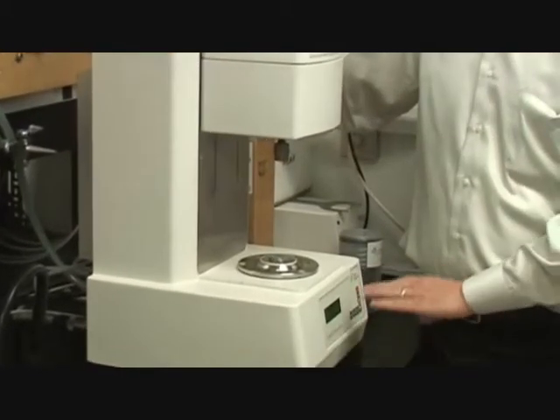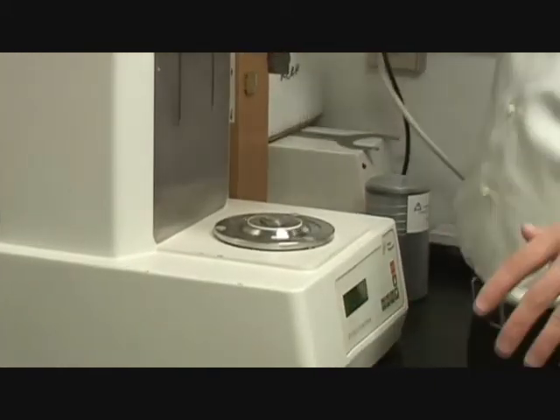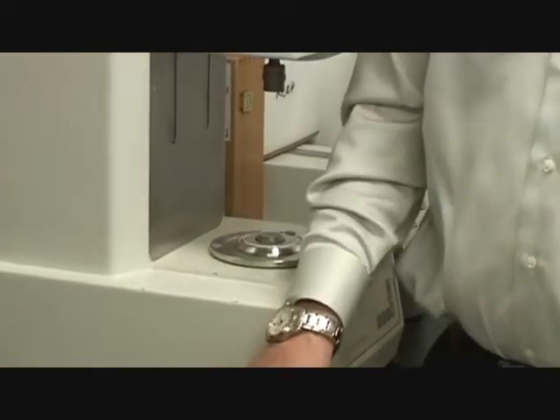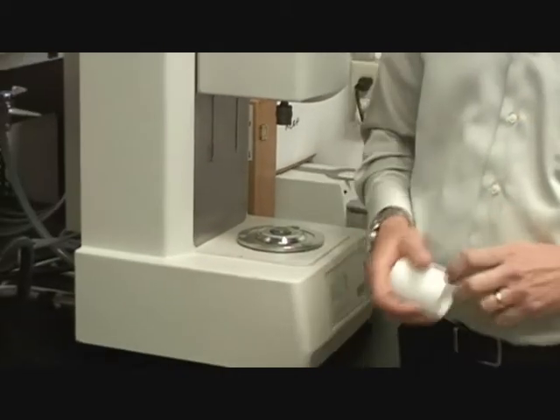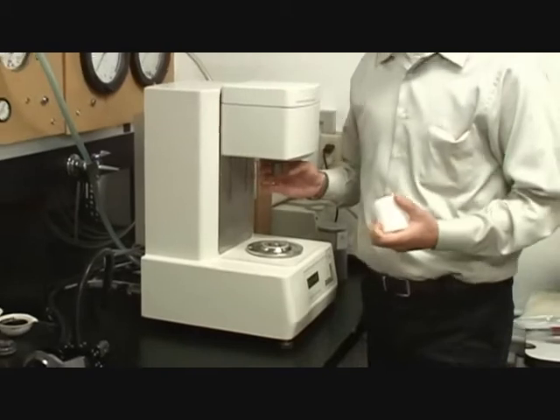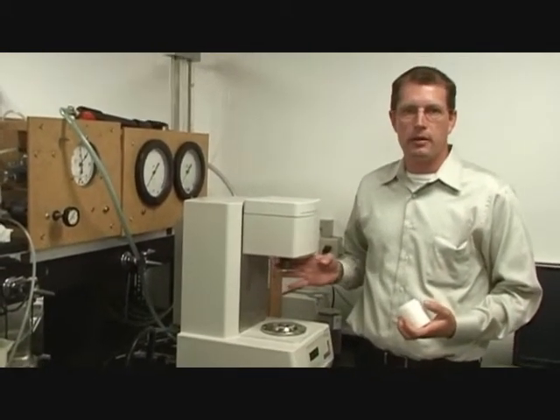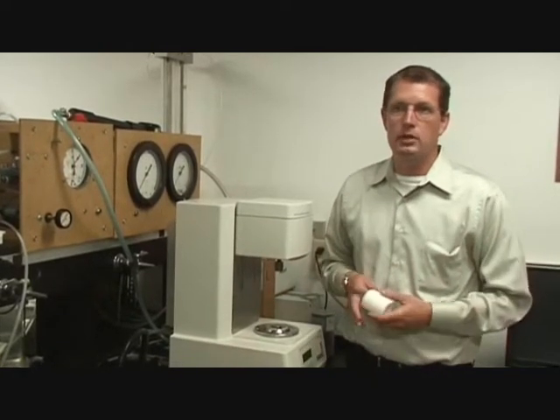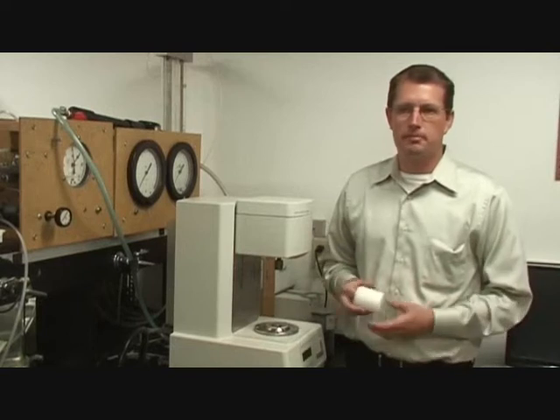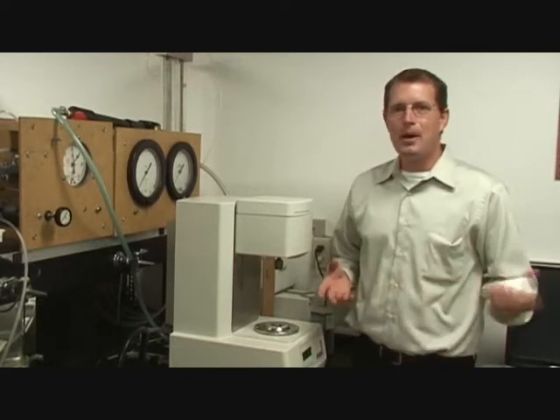If there are any other error messages hiding, right now it says okay. As long as that error message is not no air pressure, then you have air. So that's the critical thing. If you didn't have air and this bearing ever rotated, the air bearing would be shot, or at least ruined. That's the expensive item, the $12,000 to $15,000 repair. So air is the big thing.